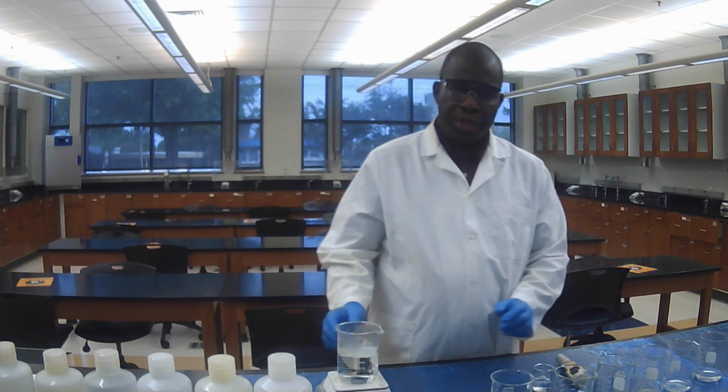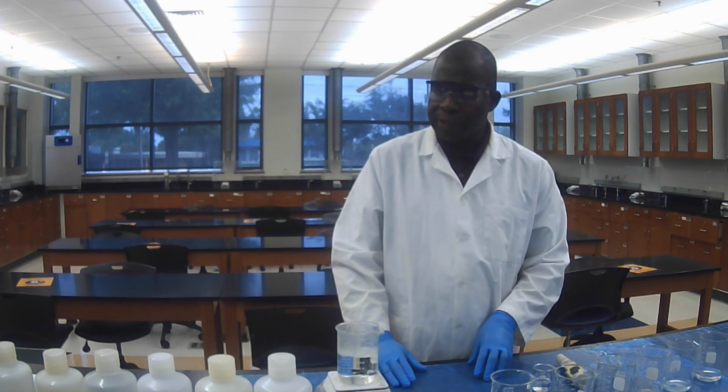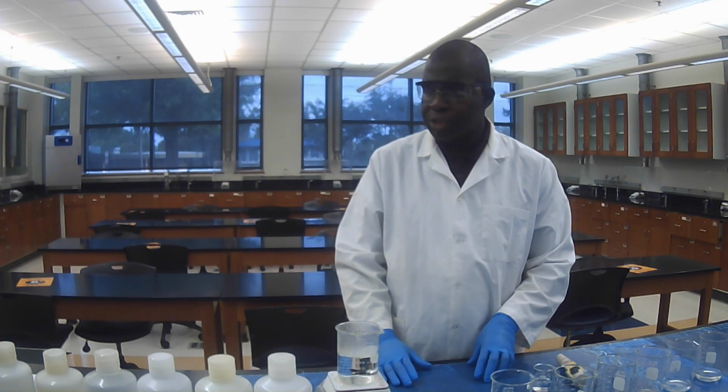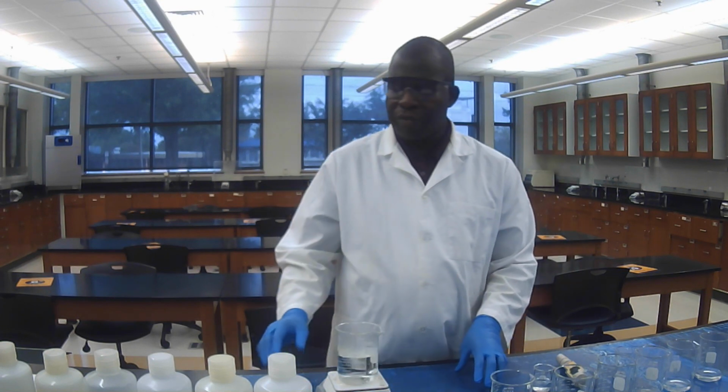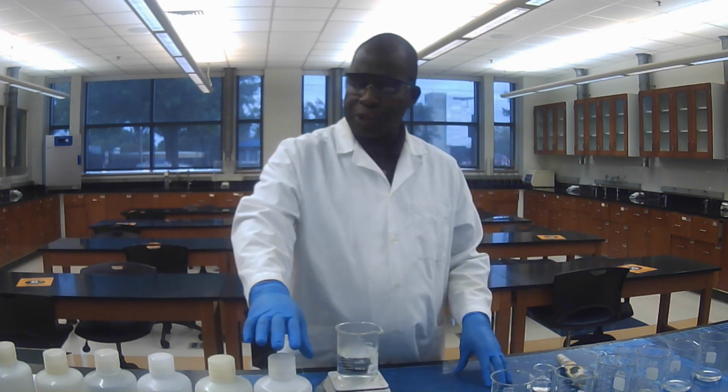You need a hot plate, and also the 6 salt solutions that have been provided to us for this experiment.